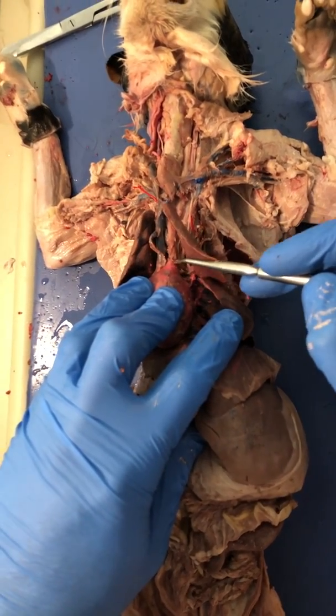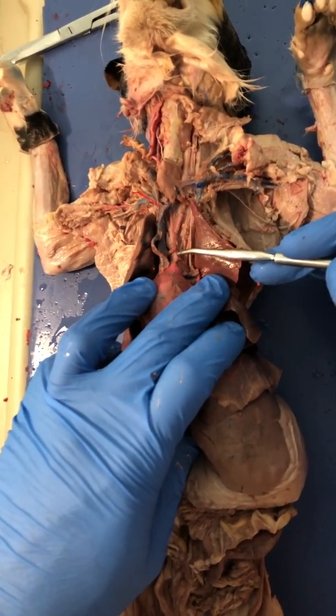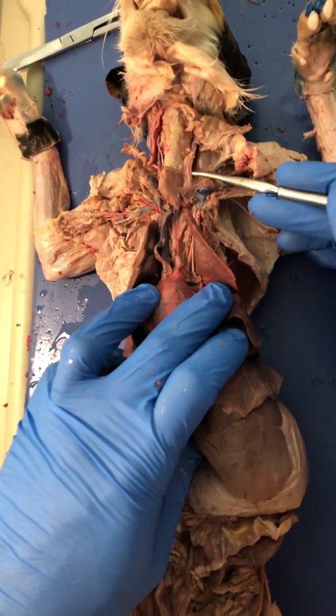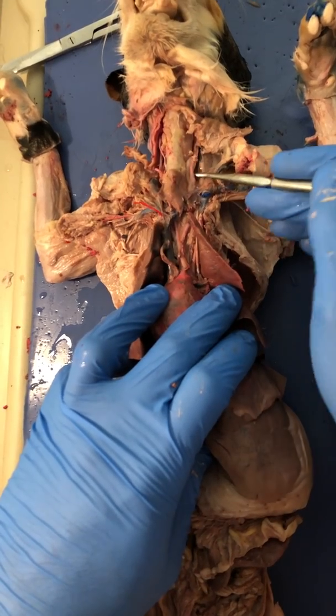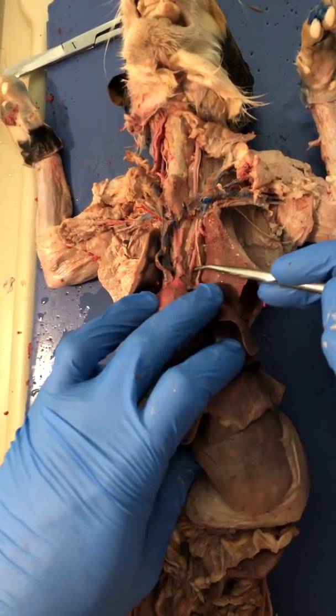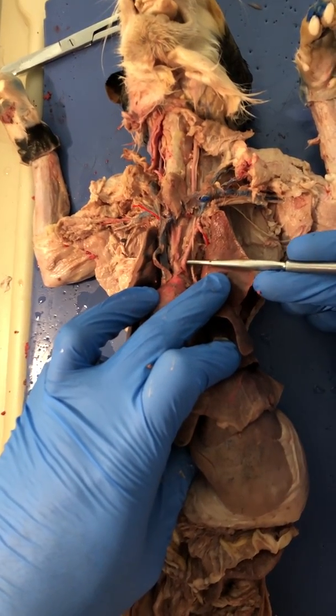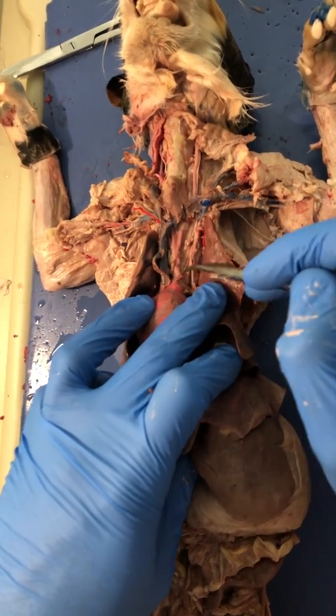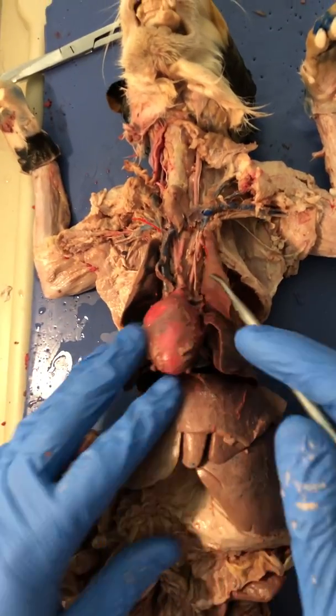We have the aortic arch. We have the brachiocephalic artery, which will branch into the right and left carotid, not jugular. This one here happened to be broken. We got over here. There's another tube coming off. This is the left subclavian for the arteries. It branches directly from the heart down, or from the aorta at that point.